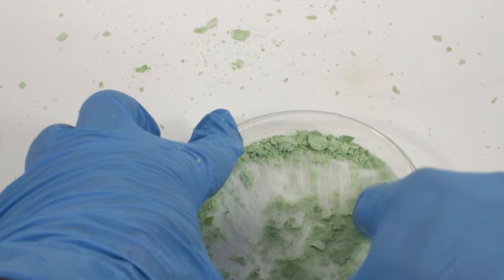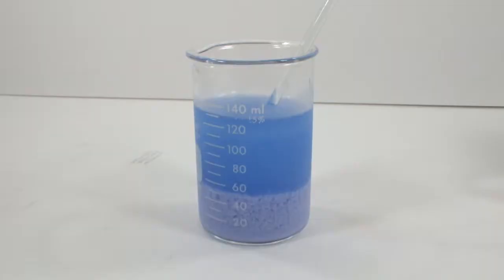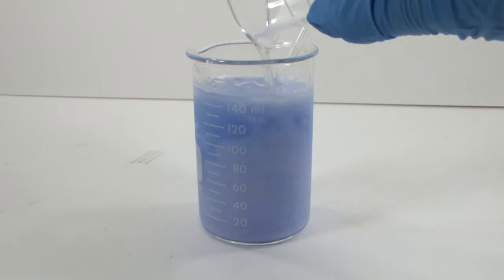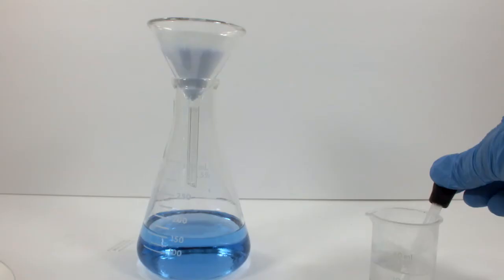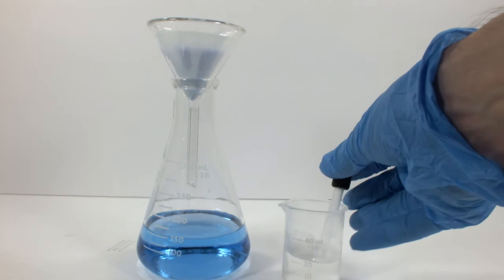But I know the procedure worked, so I'm going to try it again, exactly as before, but improve the conditions for drying. This is the second batch, and that's an example of what it looks like when you do still need more acetone. I wanted to put that in there, so you know what I meant when I said, if you add acetone and get more precipitate, rather than just dumping in half the bottle.